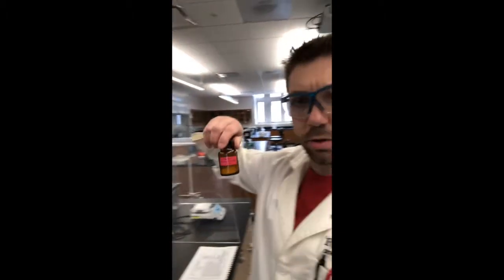So the first thing I'm going to do is go ahead and weigh out the catalyst and what's called lutidinium paratoluene sulfonate, and lutidine is basically a pyridine derivative, and you all know that paratoluene sulfonic acid is just sort of an organic acid that is used for acid catalysis of reactions.